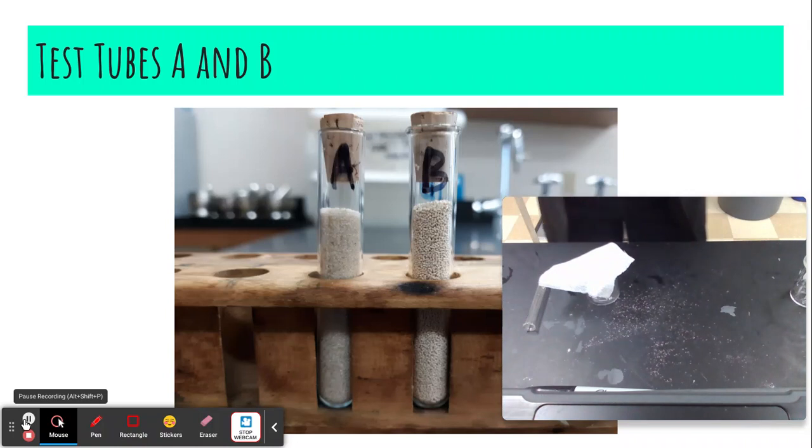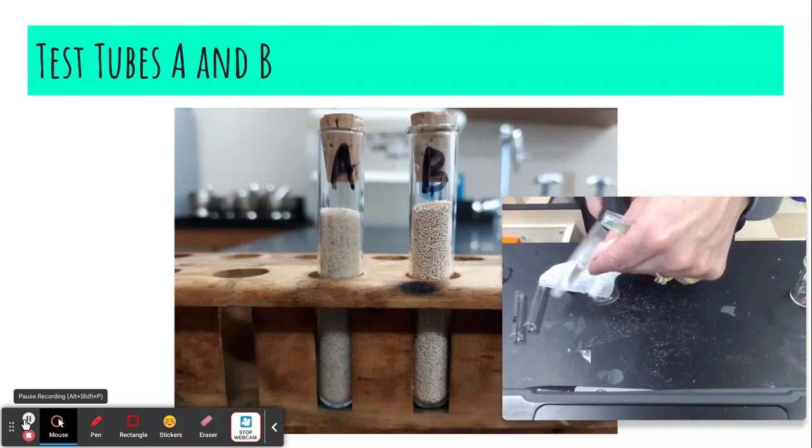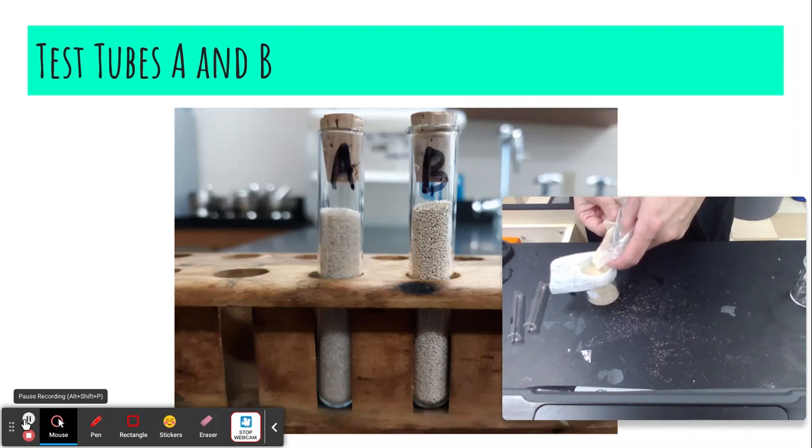And I'm going to cut a little hole in my baggie, and it's going to drain. I hope I don't make a big mistake and make a huge mess. That'd be kind of embarrassing. So I'm going to cut off the end right here, and then I'm just going to drain it onto this. I hope you can see this okay. Oops. There we go. It's working. I did B instead of A. I think I said I was going to do A first, but I did B first.